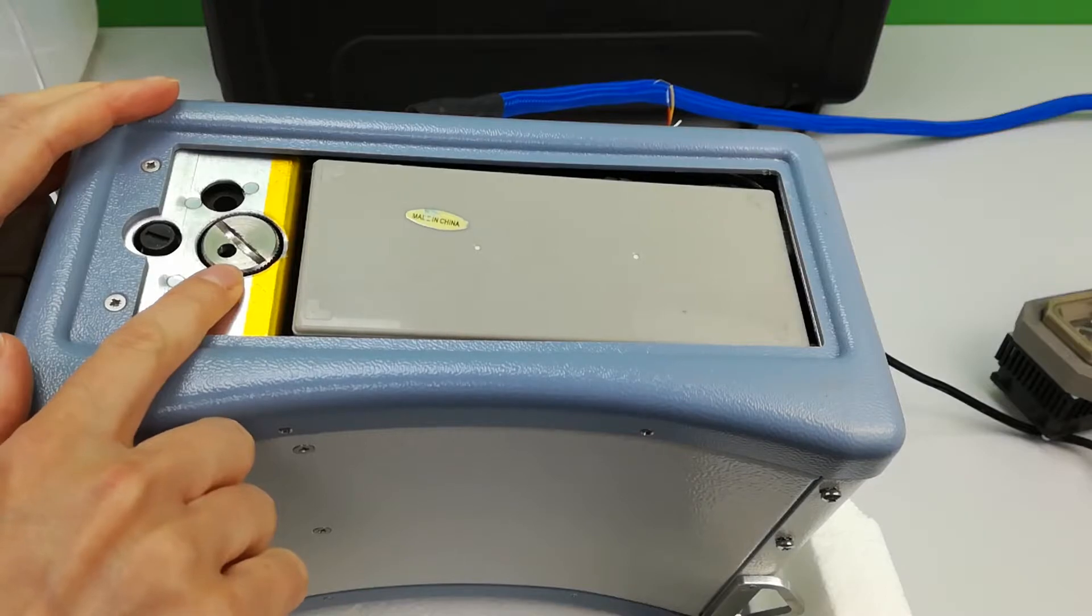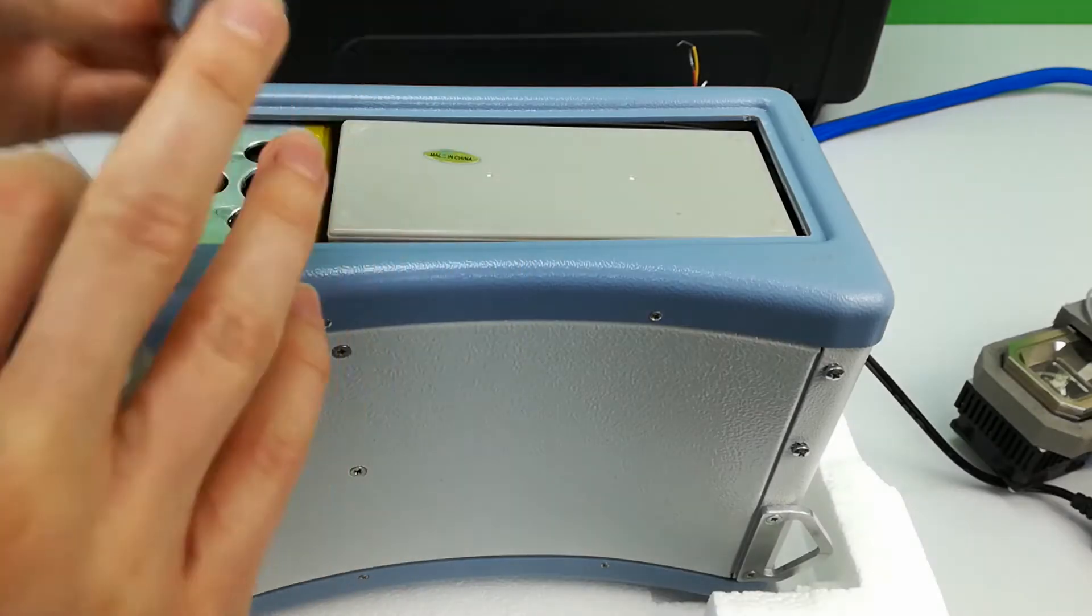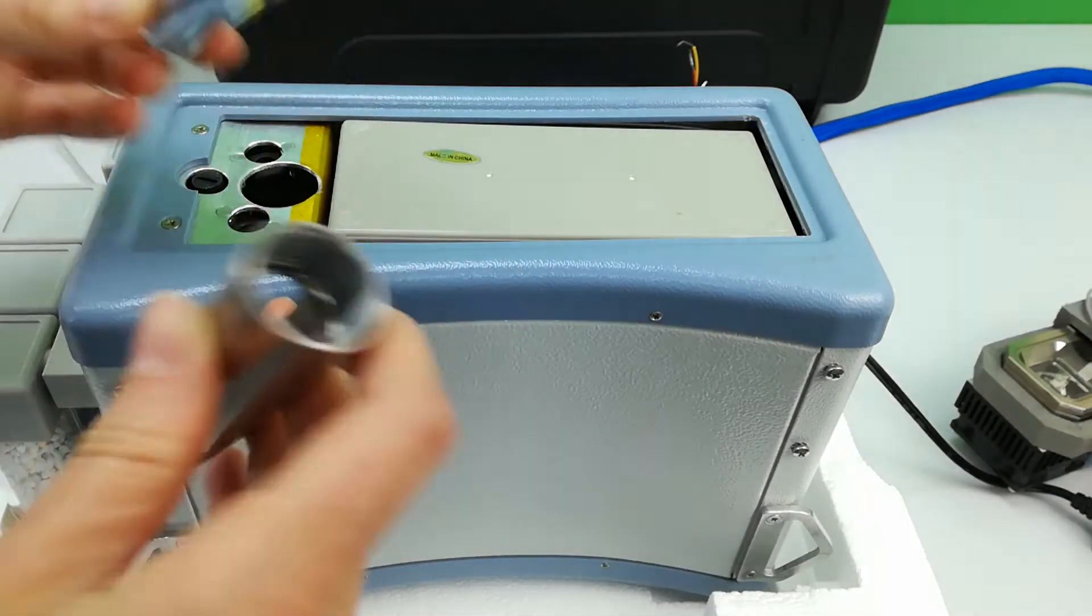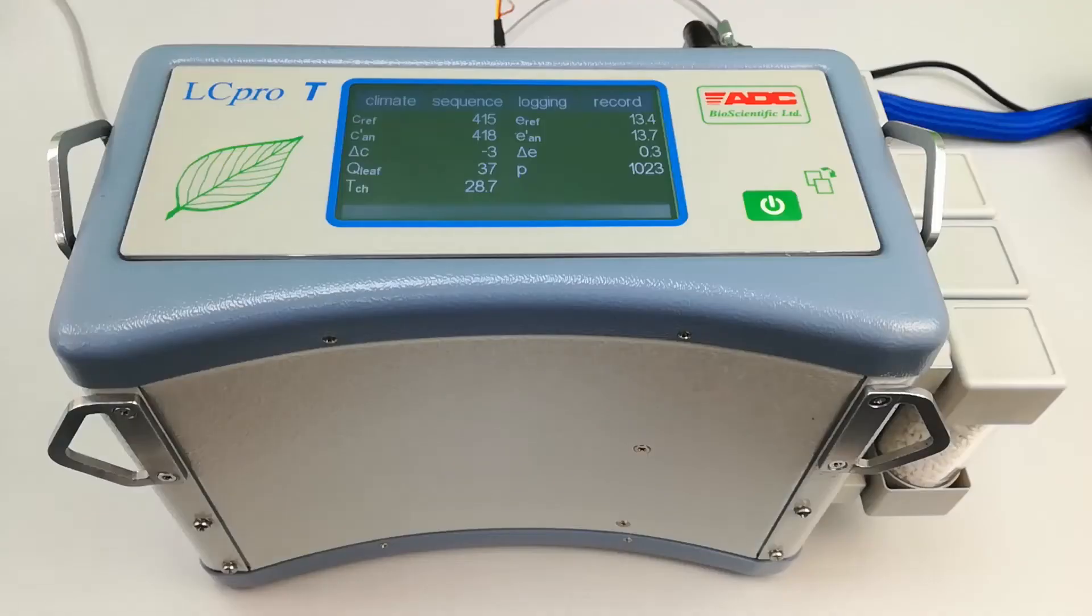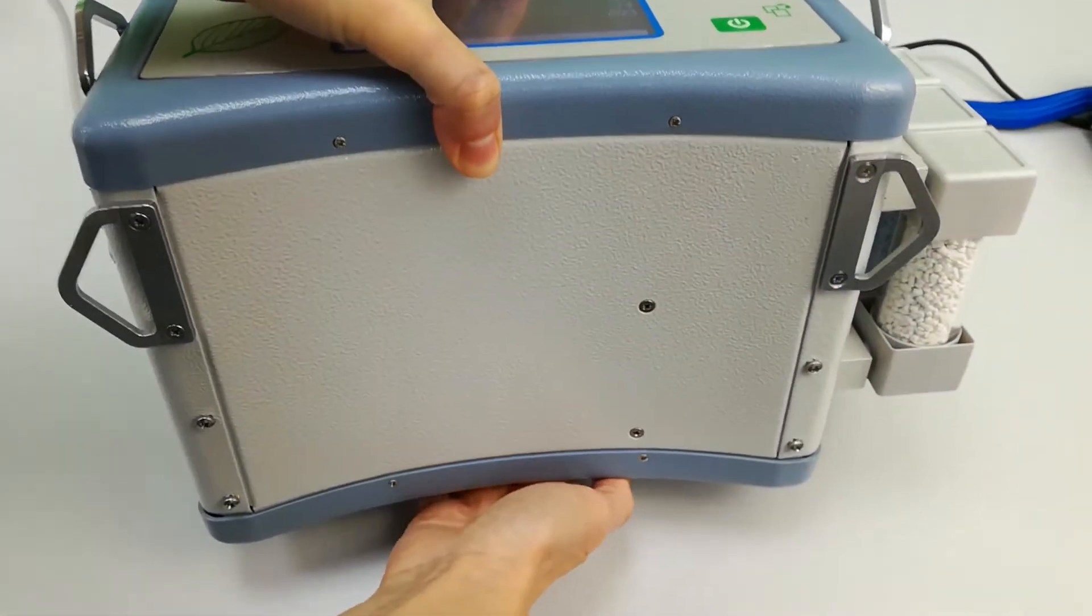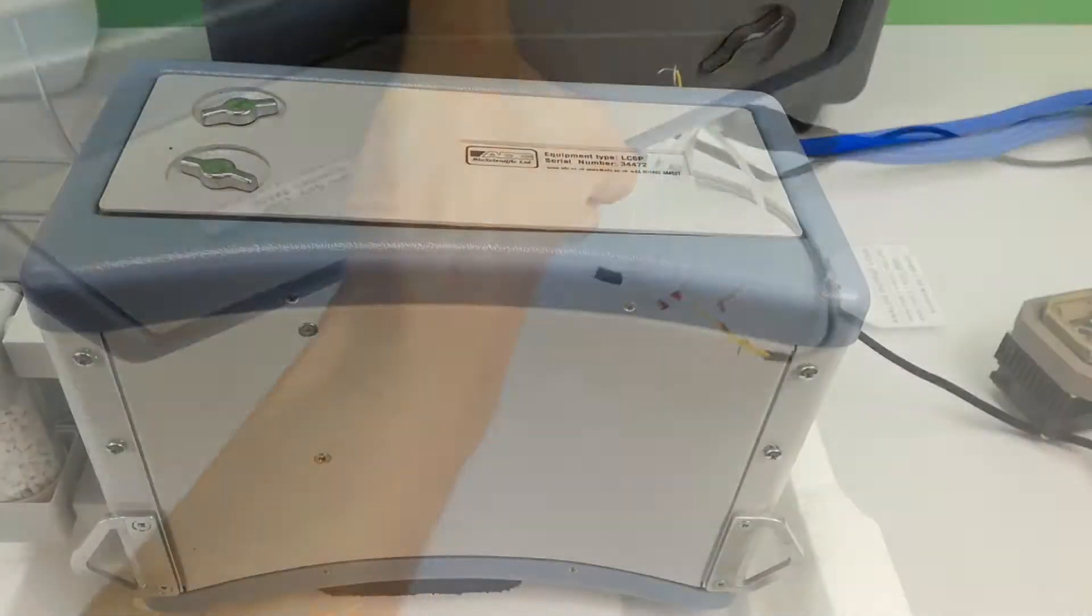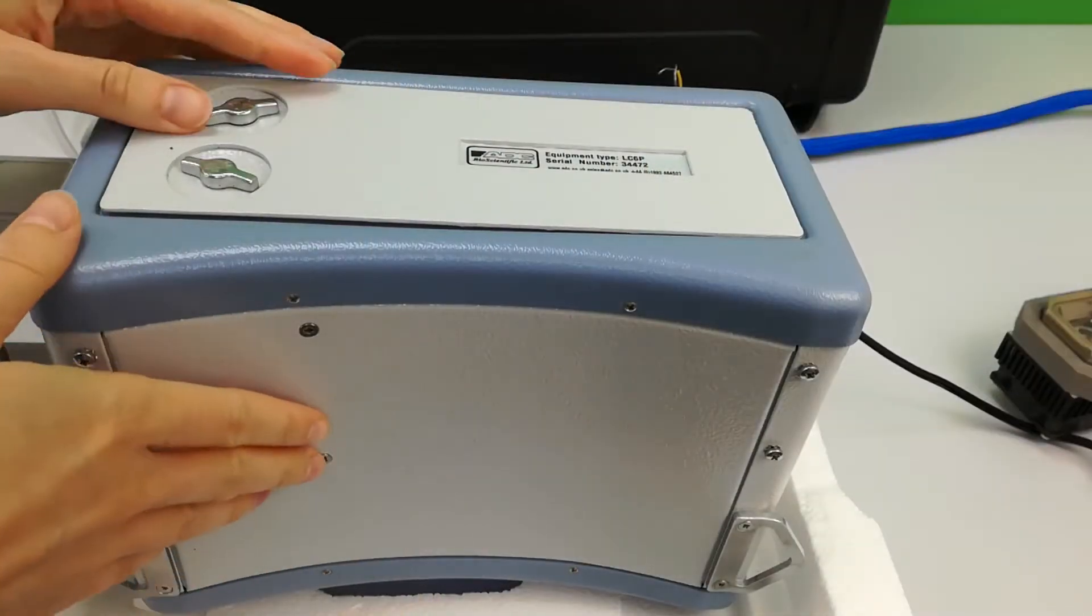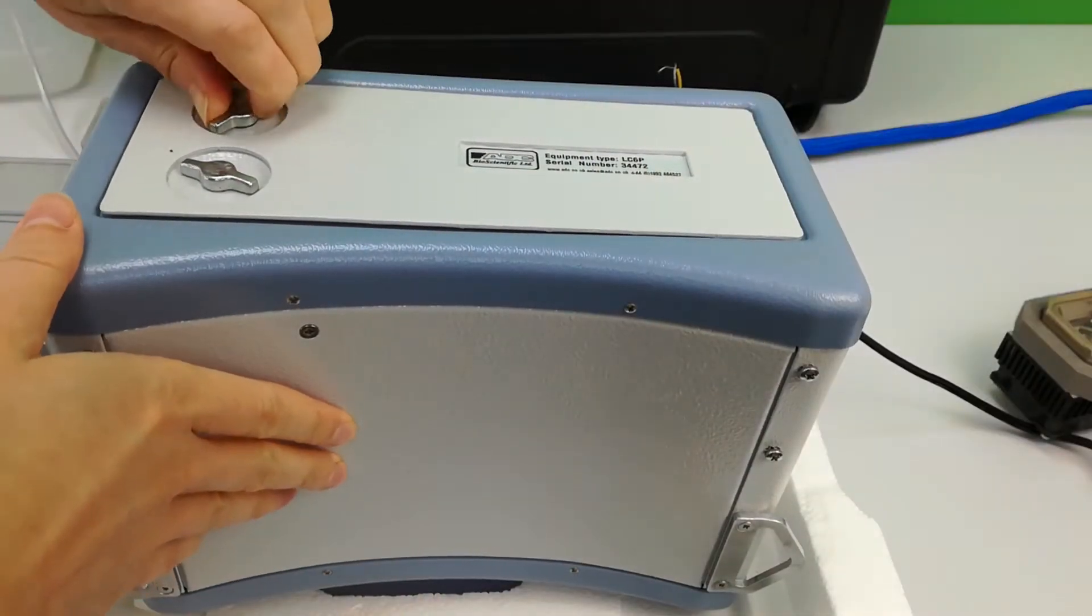A new LC-PRO-T is fitted with an empty cartridge. To fit a new CO2 cartridge, turn the console upside down and remove the battery compartment cover.